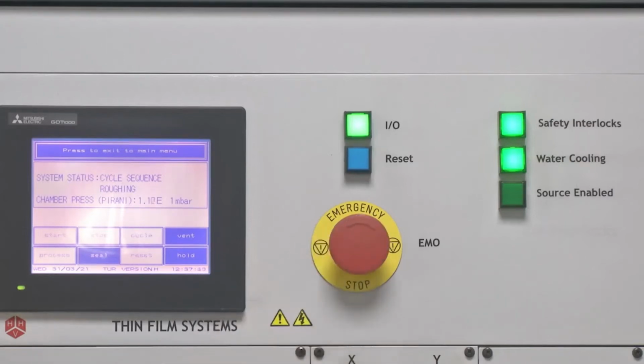This emergency stop button comes in very useful when there is any kind of system issue, such as vacuum is stuck, or there is limited power supply through UPS in case of sudden interruption of regular power supply. In all such cases, or in any other cases which are not considered in usual routine runs, the emergency stop button helps to completely shut down the system to prevent any further damage to the chamber, to the system electronics, as well as to the user, resulting in any kind of shock, and for fire prevention as well. This emergency stop button is to be used only for emergency cases, as the name suggests.